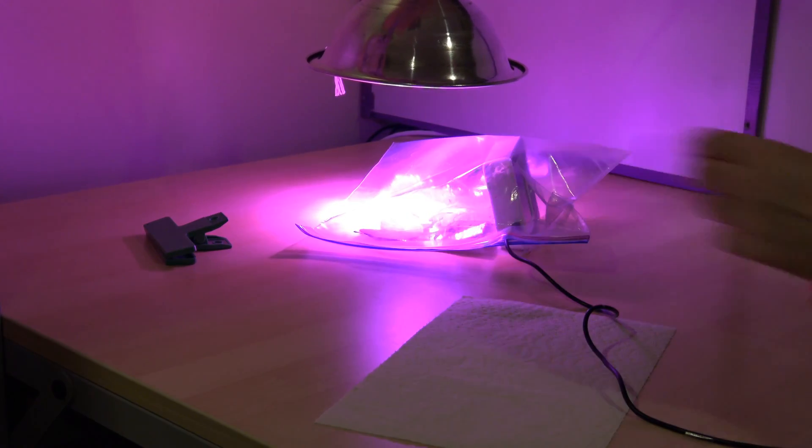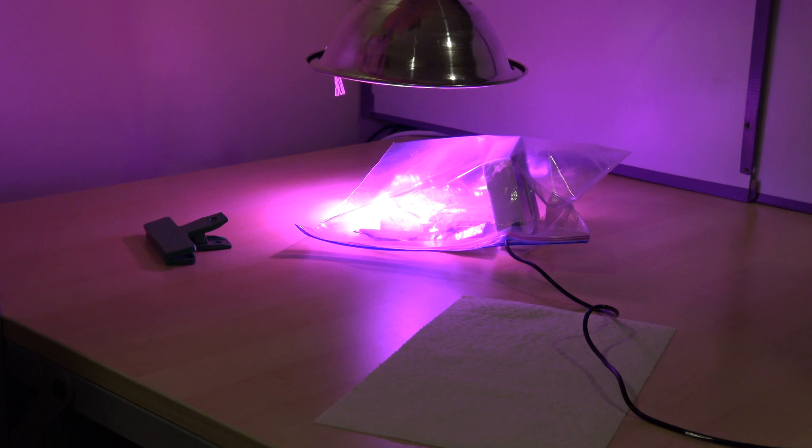At this point you can start your timer so you'll be ready to take readings at five and ten minutes. What we're looking for is a drop in carbon dioxide level of about 50 ppm within five minutes.